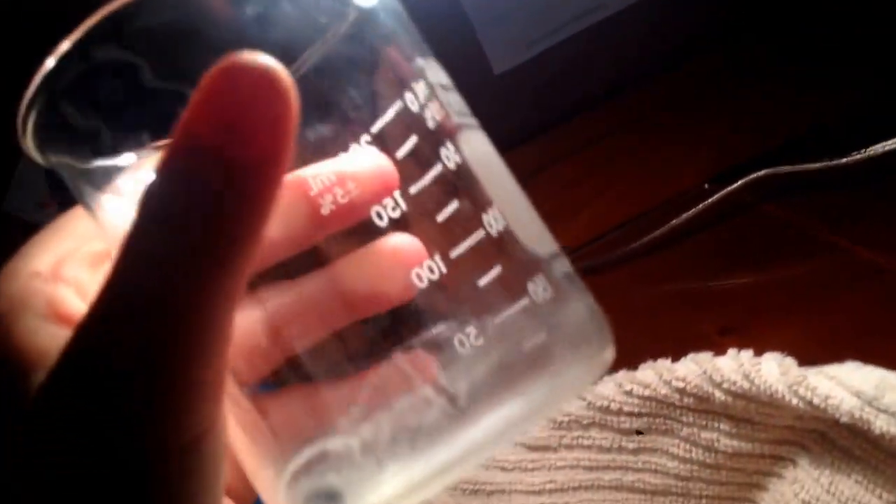After two microwave runs, here's the beaker — you can see there's barely any zinc oxide left, but you can still see there is some. That's okay, because this was more proof of concept than an attempt to extract the chemical. As you can see, most of the zinc oxide was degraded by the acid.